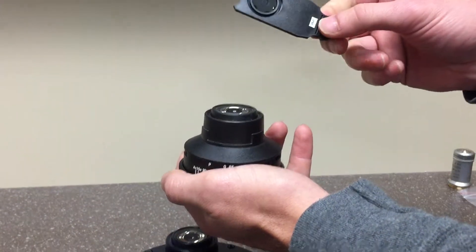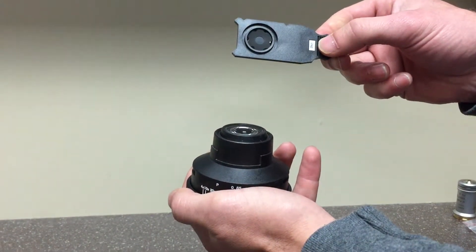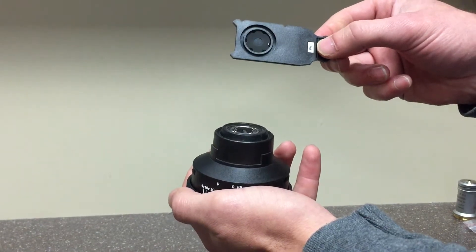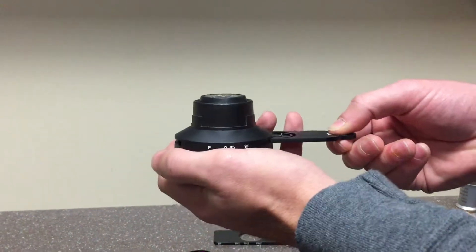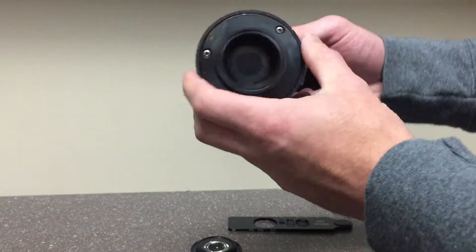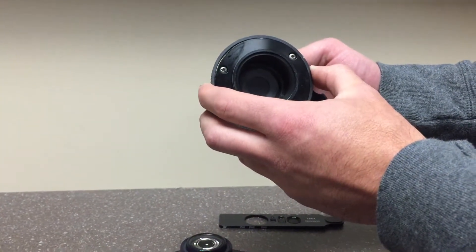Alternatively, there's a single phase contrast slider. If you only have one objective on your microscope that's phase, you'll insert the slider into position and you'll have phase contrast.